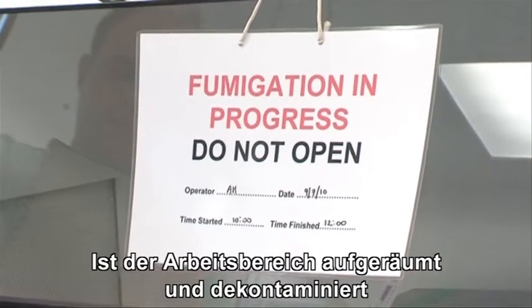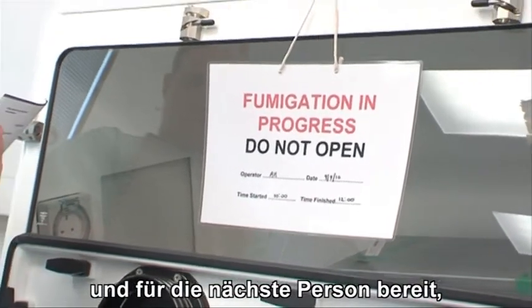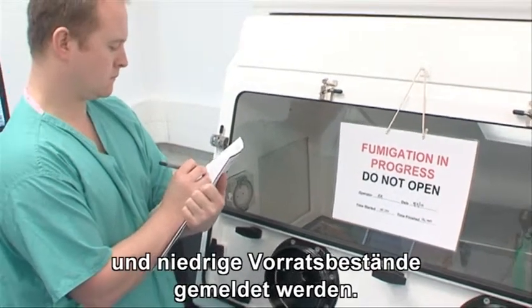Once the working area is organised, has been cleaned and decontaminated and is ready for the next person, all required logbooks must be completed and any low stocks notified.